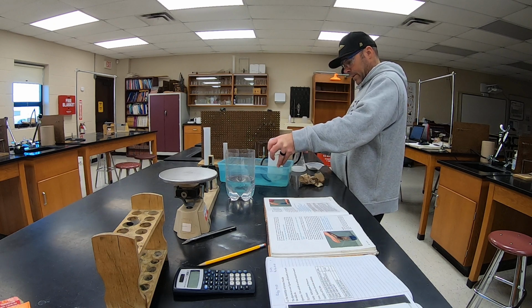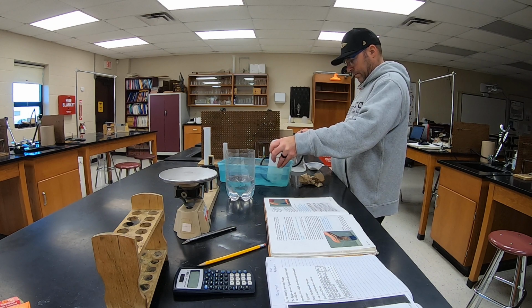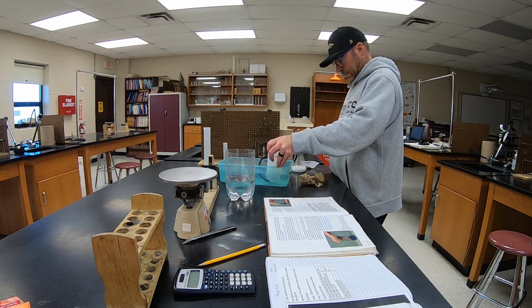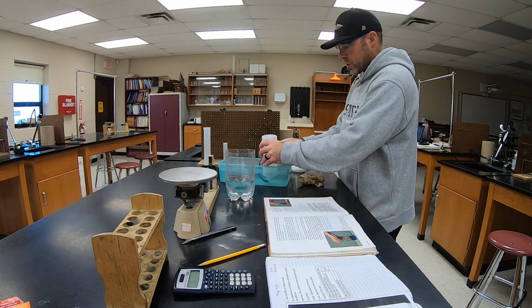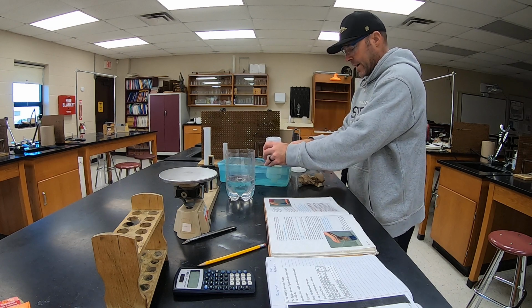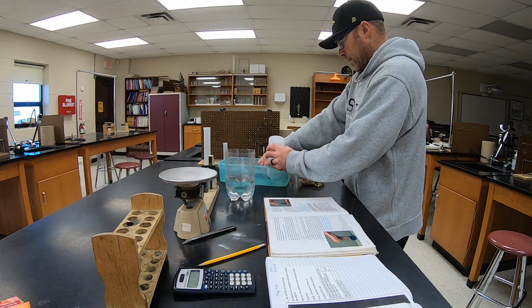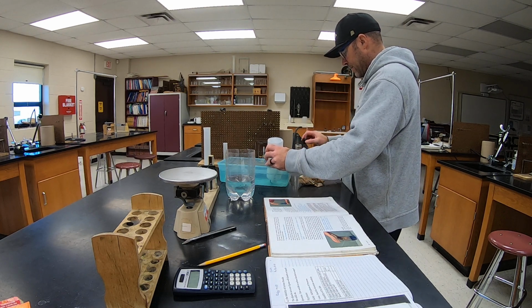We're going to tip it up a little bit so that all of that water gets pushed out, and it should start to bubble, and you can see that it's bubbling. So now I'm going to take my hand over the end of this. We should have a full bottle of carbon dioxide gas. I'm actually going to run this up inside of it, to make sure we push any air out if there is any.